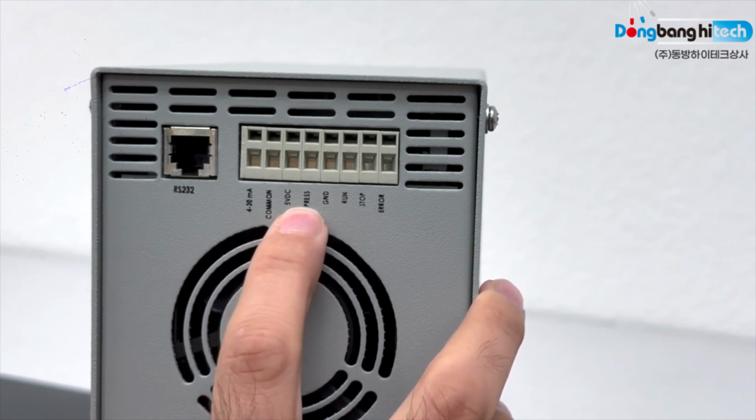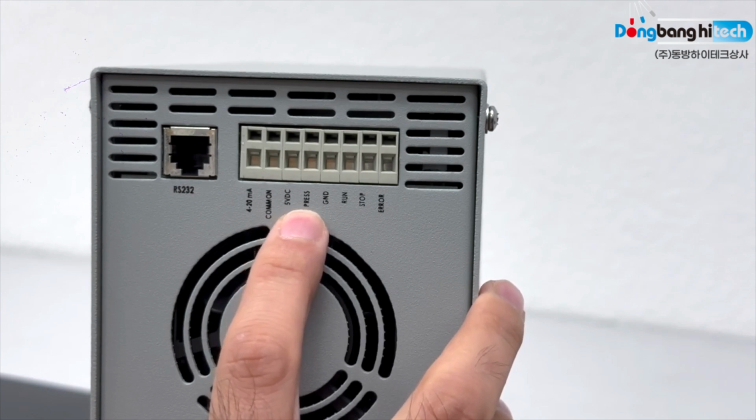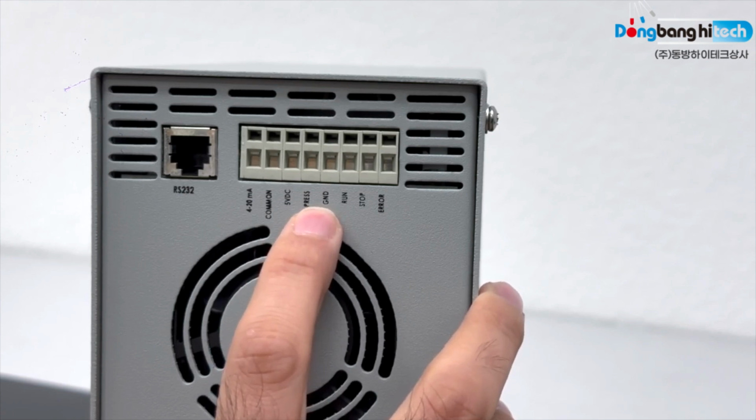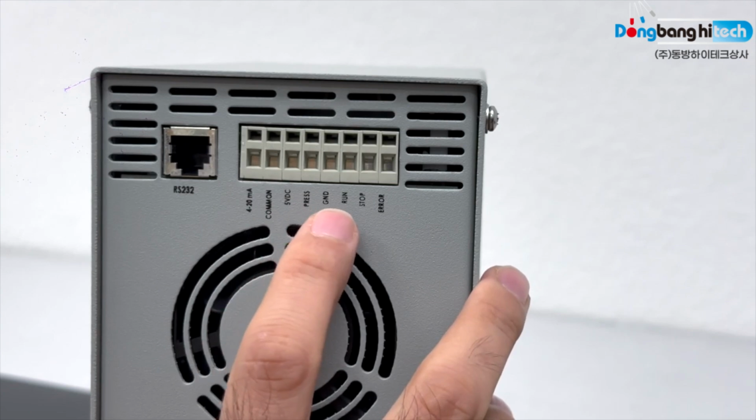Position 4 is press, output of pressure, 0 to 5-volt DC output of pressure when optional damper is installed, or when you are in the flow mode, 0 to 5-volt DC. Signal output is on position 4, used with the ground on position 5. Position 5 is ground, used in conjunction with position 4 or position 8.